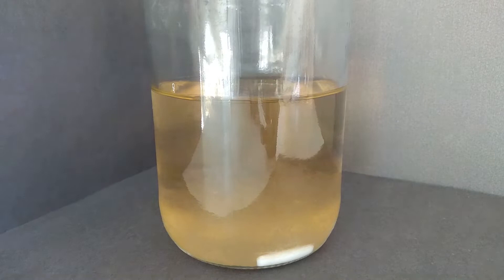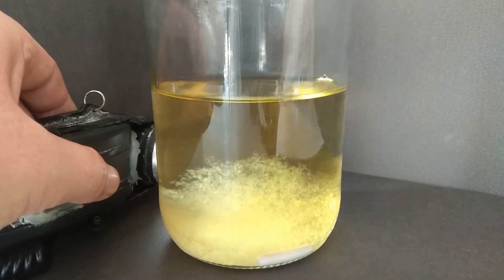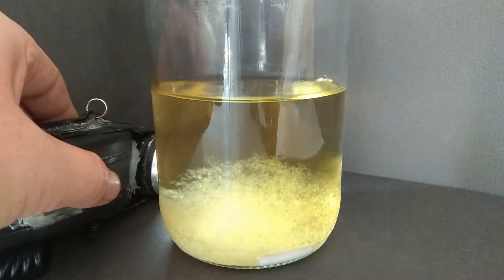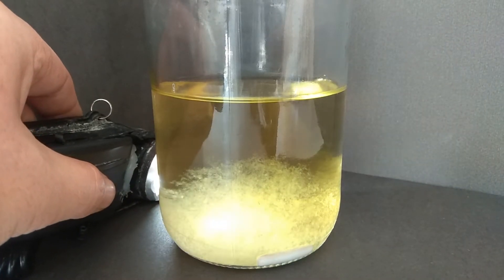Today is the 6th day. It has taken up about a third of our jar and looks healthy. Let's see the jar again in a few days.